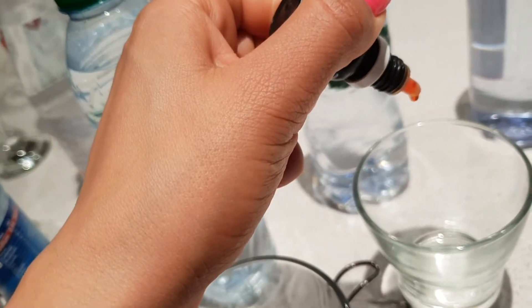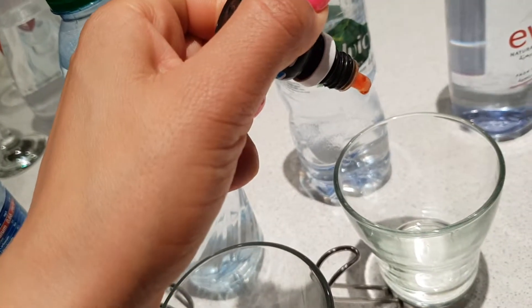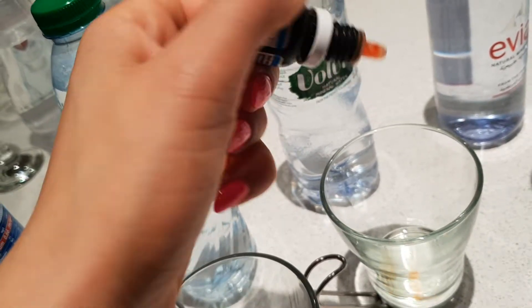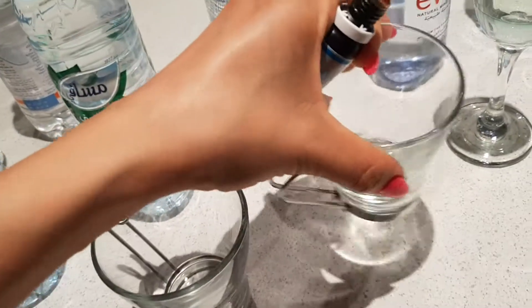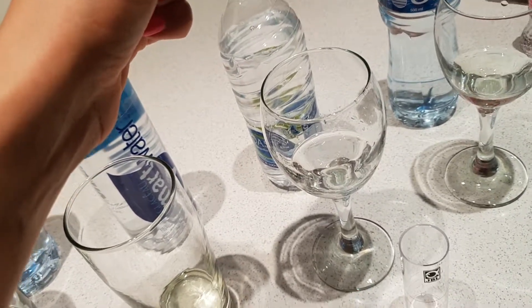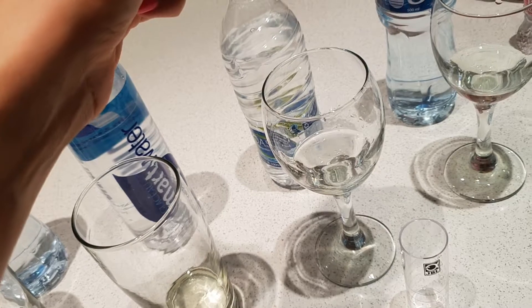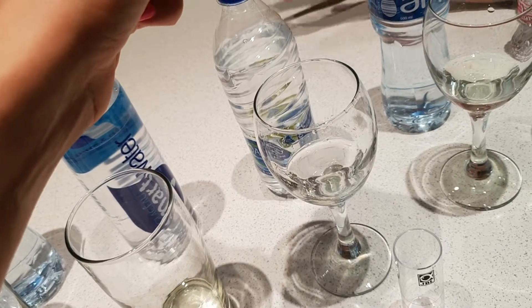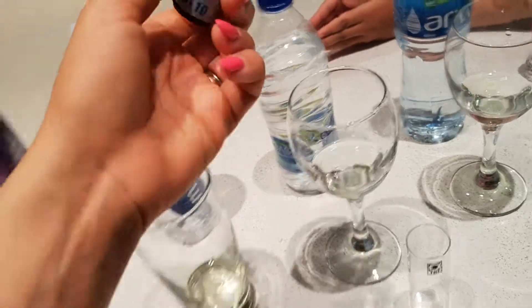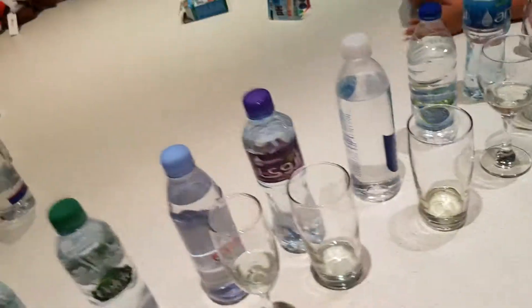This blue — yes, it's actually bad. Too much blue water is not good. Mix it, mix it. Is that 20 ml? How much green? Just enough green, because we need to be in the middle. Out of all the colors, that's pH 9. If they're lying to us — Masafi. Can I do the drops?